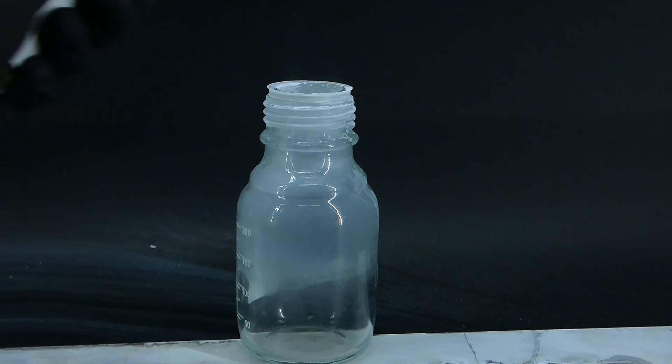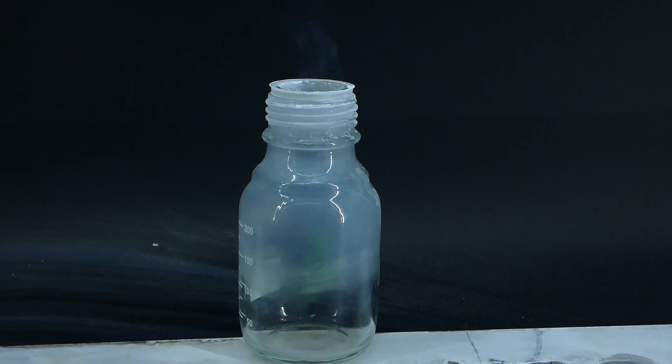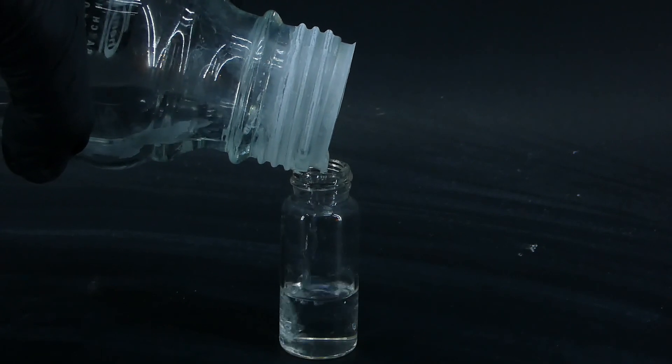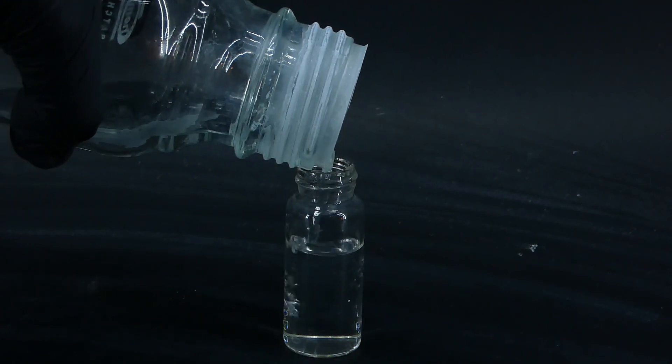After playing with the trimethyl borate, it was time to see what I have left, because in the air, it quickly hydrolyzes back to boric acid and methanol, and to prevent that, I poured the rest into a tightly sealed vial for long term storage.